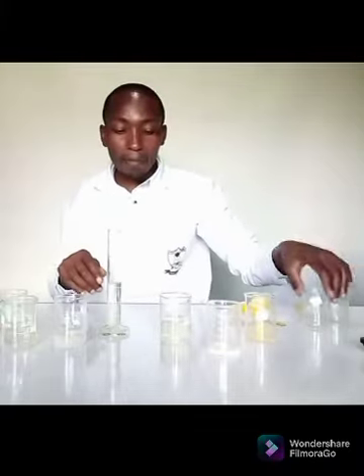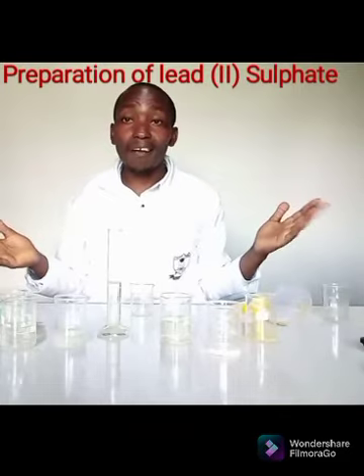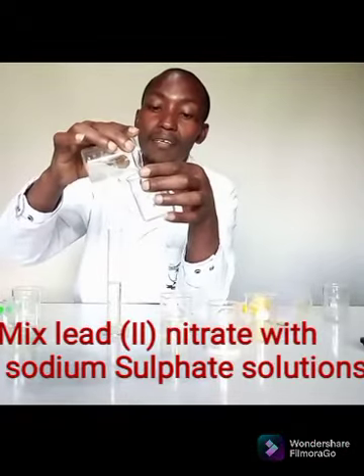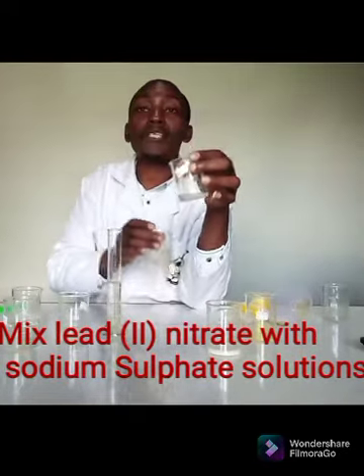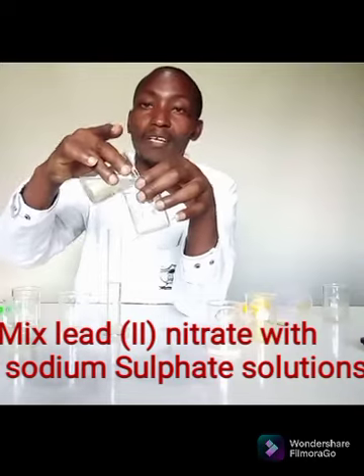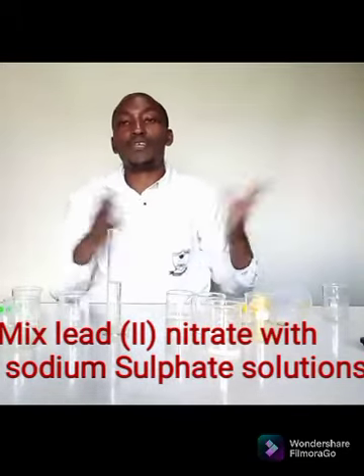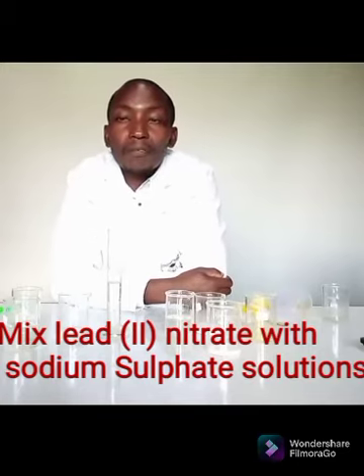If I want to prepare another one, I can prepare lead II sulfate. I still need the original lead II nitrate solution I started with. Then I can bring in sodium sulfate. Again, you can see a white precipitate has been formed. That is lead II sulfate, which is an insoluble salt.